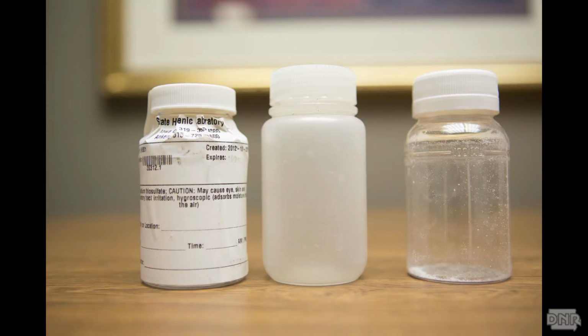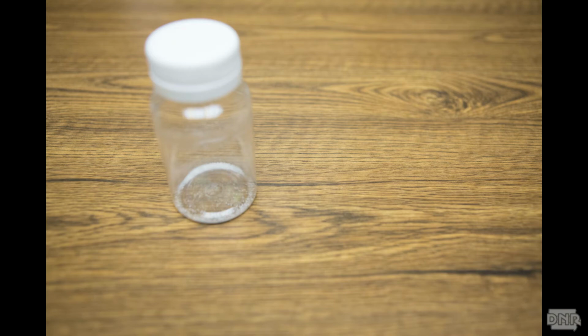First, be sure that you have the correct sample bottles for coliform bacteria sample analysis. The sample bottle must be sterile and provided by your certified lab. Different labs provide different types of bottles, so it is important to be certain you have a bottle for coliform bacteria testing. The bottles are sterile, so be sure the seal, if there is one, is intact. If there is any question about the integrity of the bottle, do not use it and get a fresh one. If you chlorinate, the bottle must contain a dechlorinating agent. This may appear as a white powder, a small tablet, or as a few drops of liquid in the sample bottle.